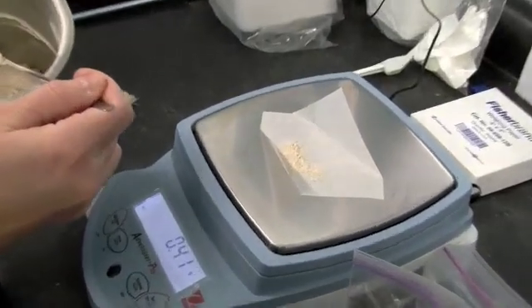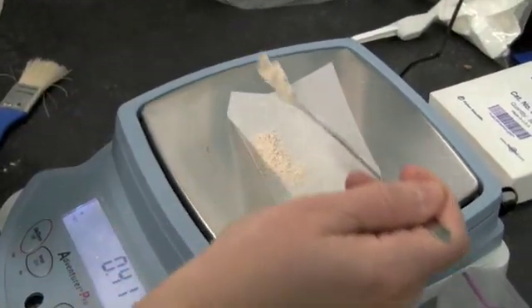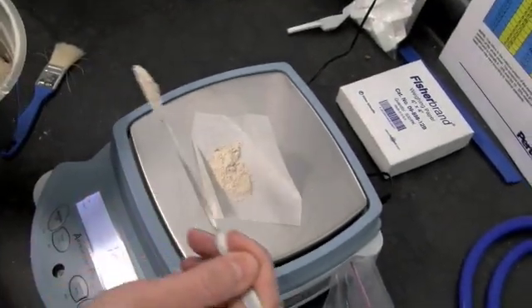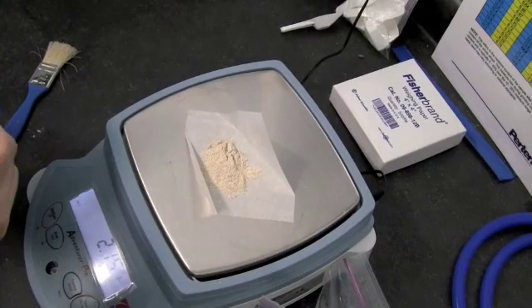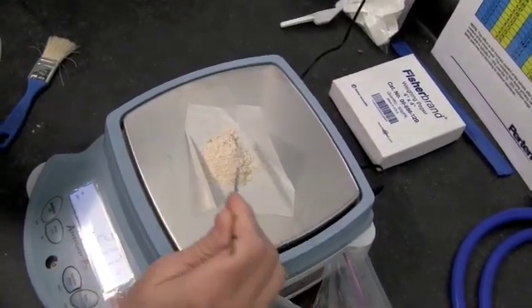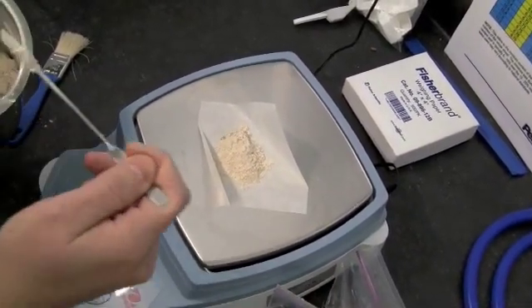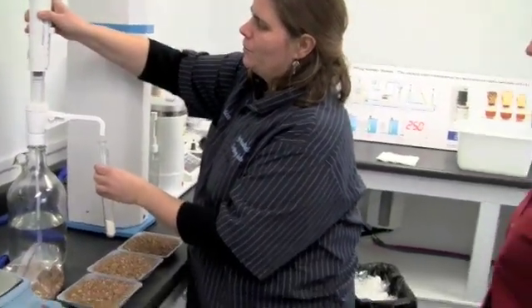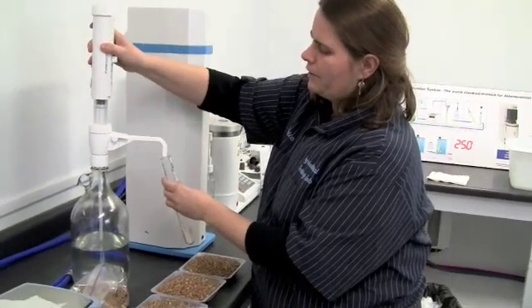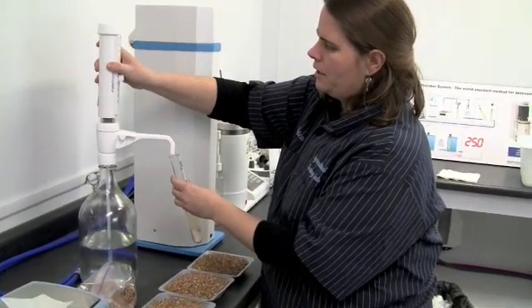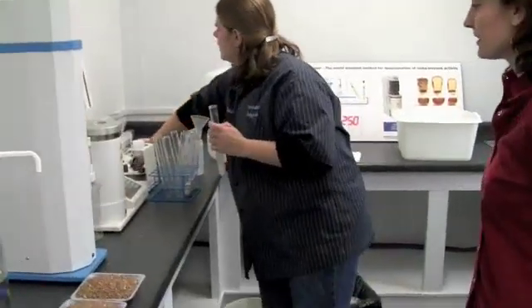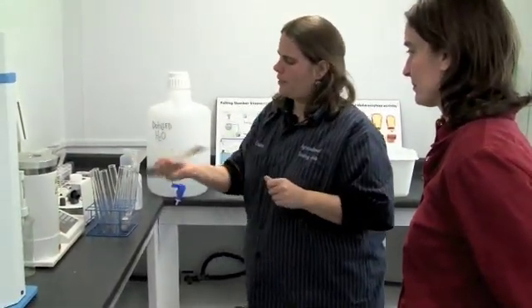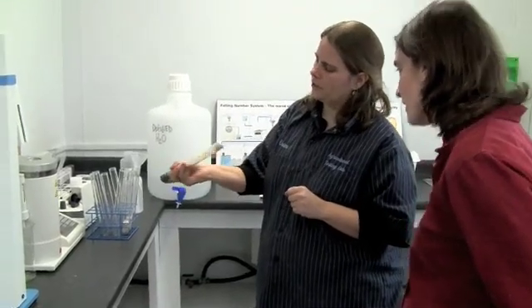We've adjusted it to 95% due to the moisture that's lost in the grinding process. So now we are weighing out 6.36 grams of flour. You're going to add 25 milliliters of water, and then you're going to cork it.